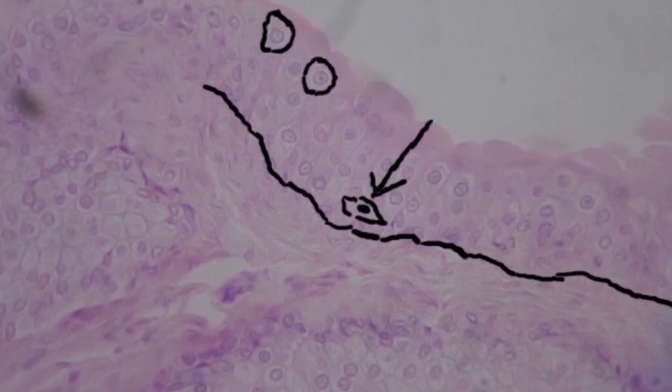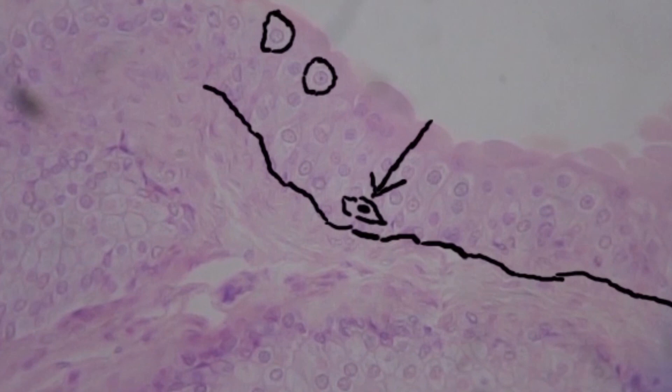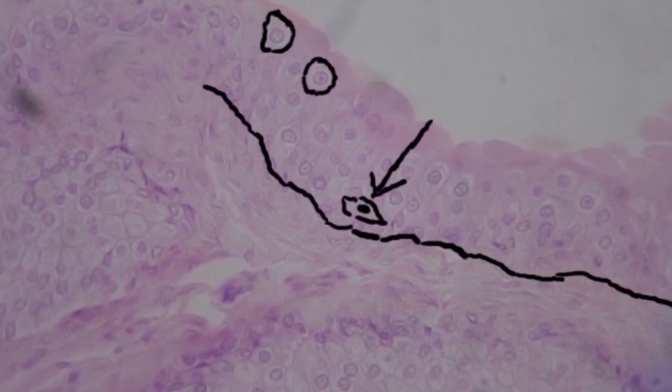That's it for epithelial cells. Remember when trying to identify epithelial cells: look at the side of the cell, find the basement membrane separating the epithelial cell from the connective tissue, figure out if the cells are simple, stratified, or pseudostratified, then figure out the cell shape — whether they're squamous, cuboidal, columnar, or transitional.